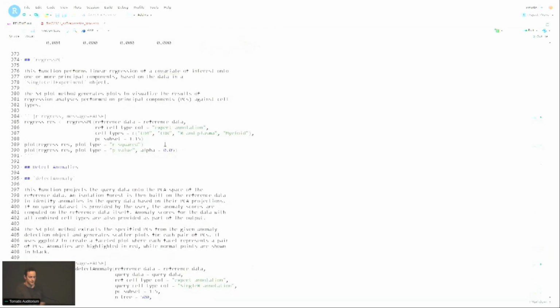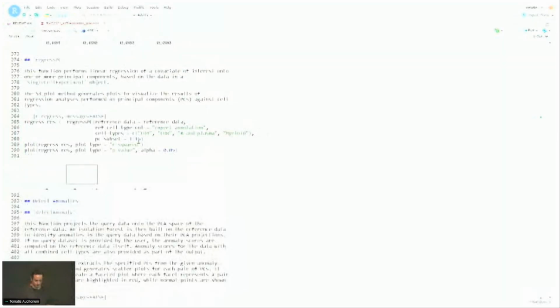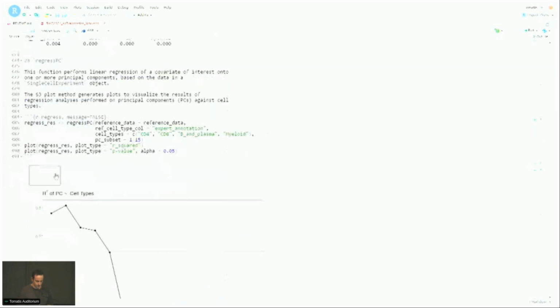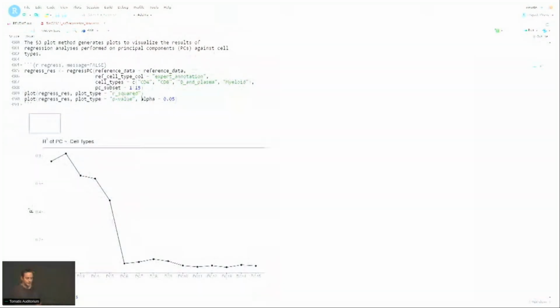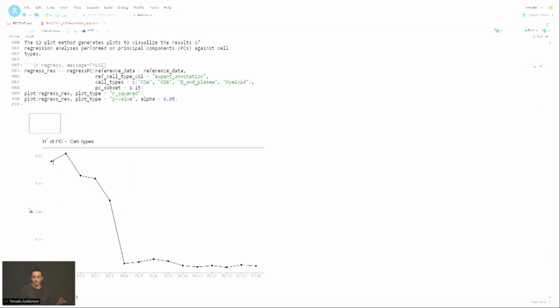All right, then there's another function here, regress PC. There's many different ways you can use this function. I only put one of them here. Essentially what we do for this function is we regress each principal component against the cell type. And then we have the proportion of the R-squared value for this regression problem, where we have one categorical predictor with, in this case, 4 categories.